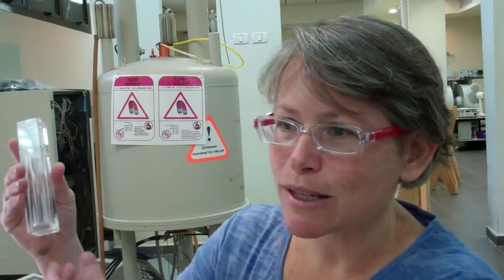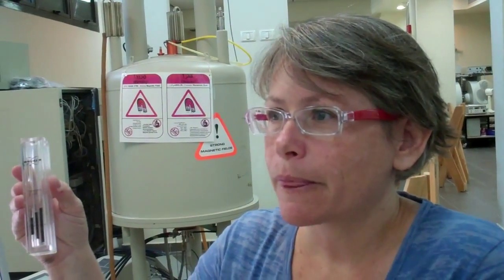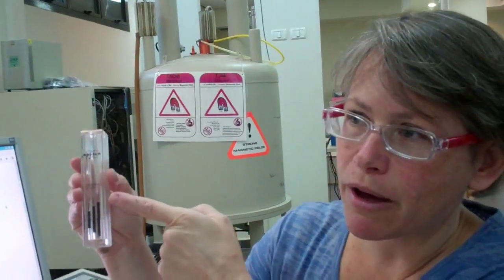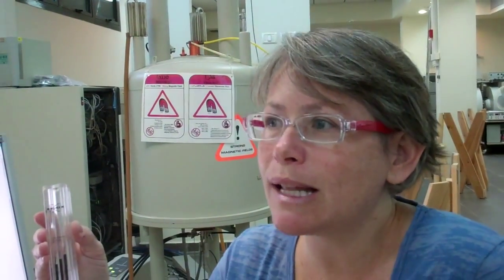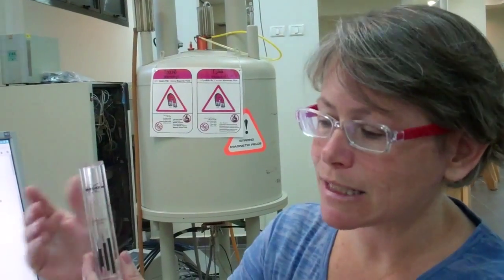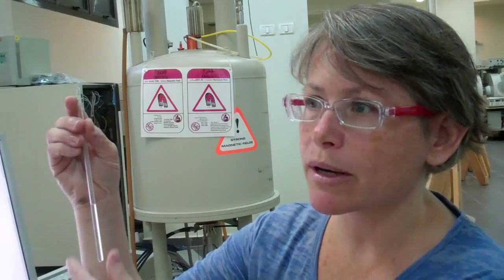We see two different markings on the depth measure that are centered the same for the two different coils. Your sample should be both above and below the black markings, or in other words, the bottom of the glass tube and the meniscus at the top of the solution should be above and below the black markings on the coil.